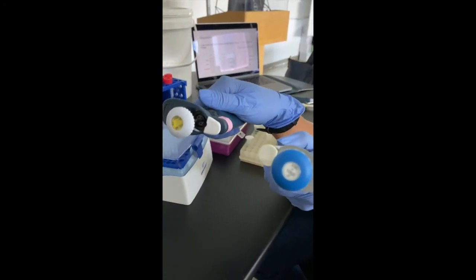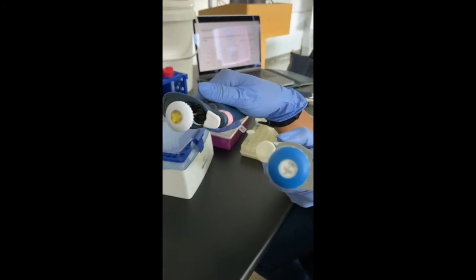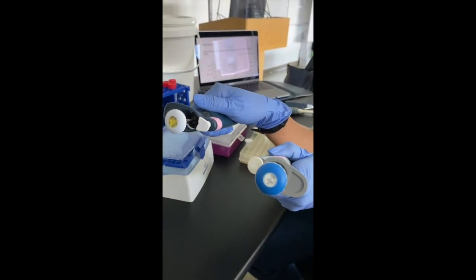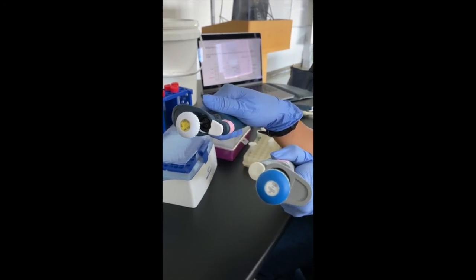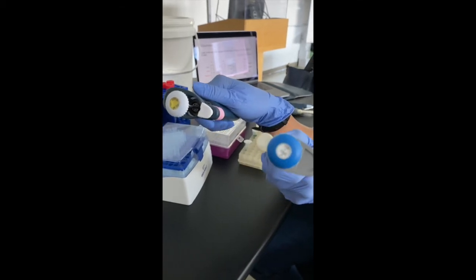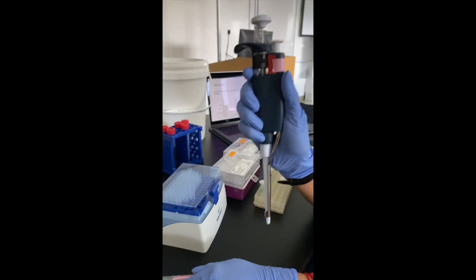But while identifying and choosing a micropipette for a specific volume, you should ensure that you choose a micropipette that has the maximum volume it can measure closest to the desired volume. So as you can see here, 120 microliters, which is your desired volume, is closer to 200 than it is to 1000 microliters. So you choose P200 to measure a volume of 120.